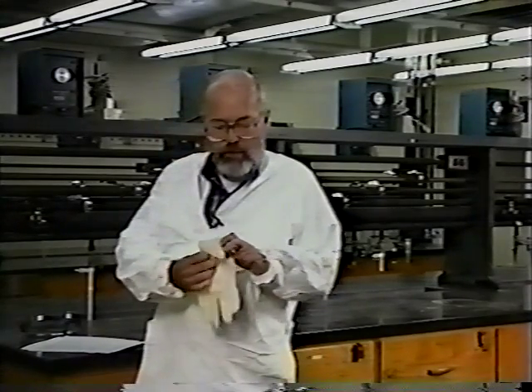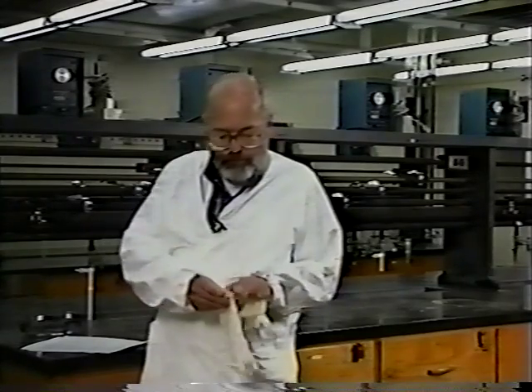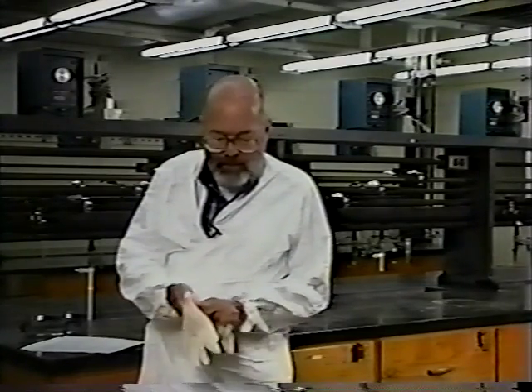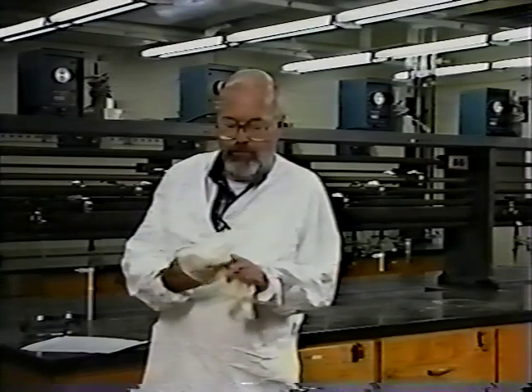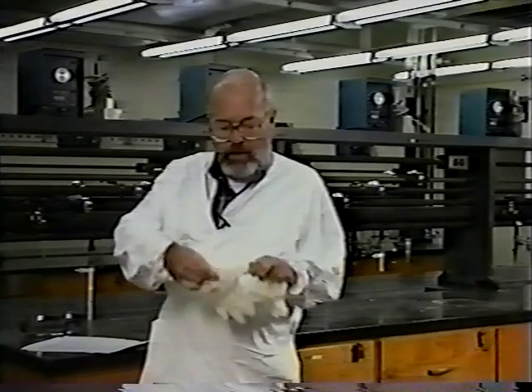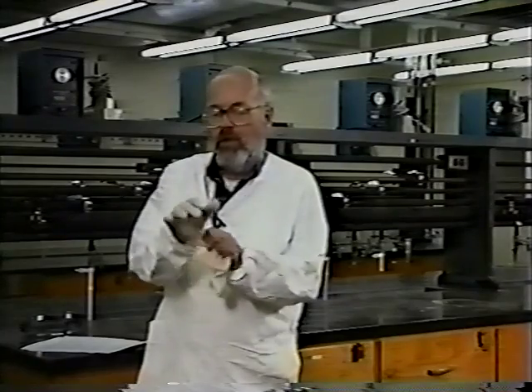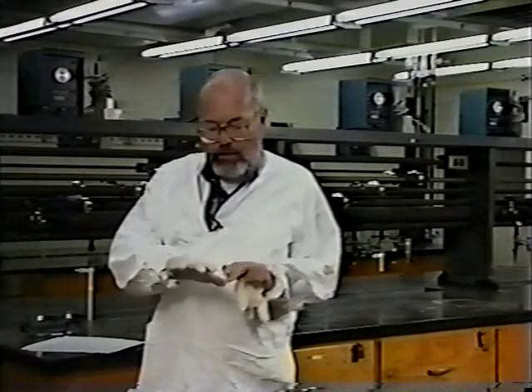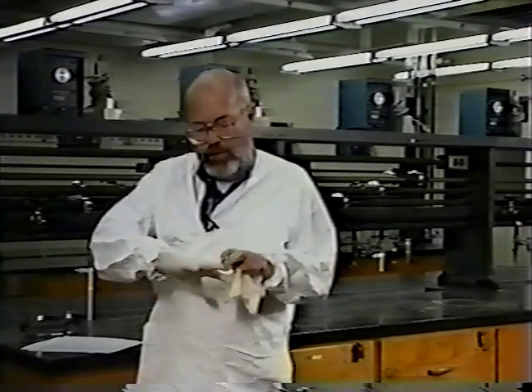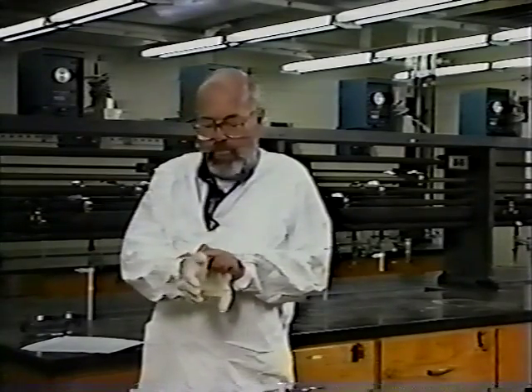Now, gloves of different kinds are also available. You may bring a pair of gloves which you buy at the grocery store, or you may buy a similar pair of gloves from the stock room, or a pair of these disposable latex gloves. These will last for a few lab periods if they are taken care of, and then can be thrown away. They are also less expensive than the more durable ones.